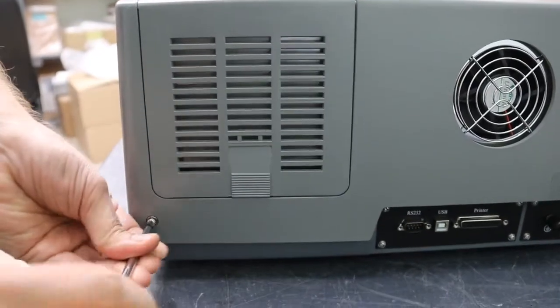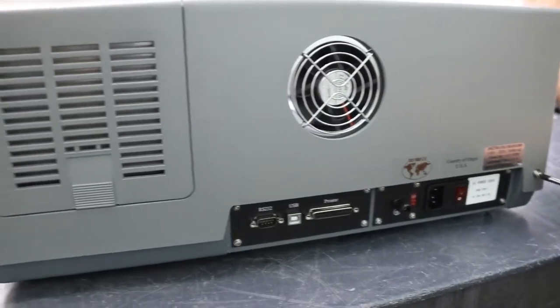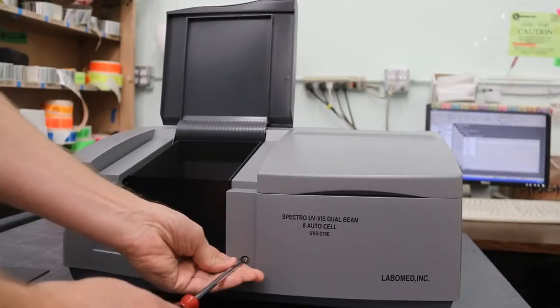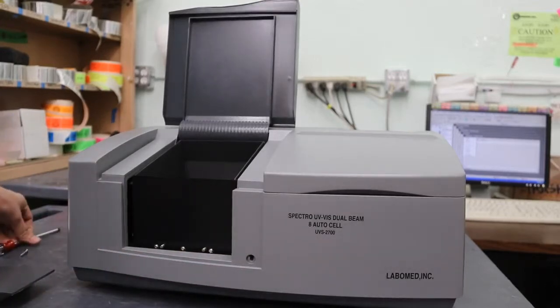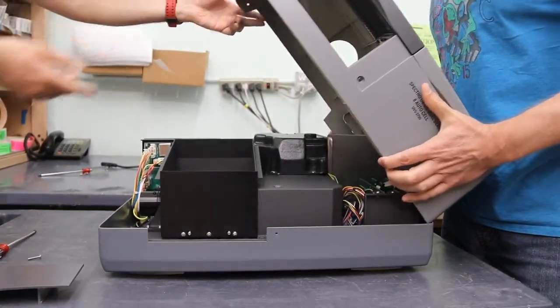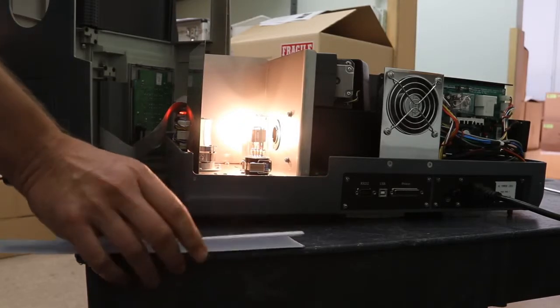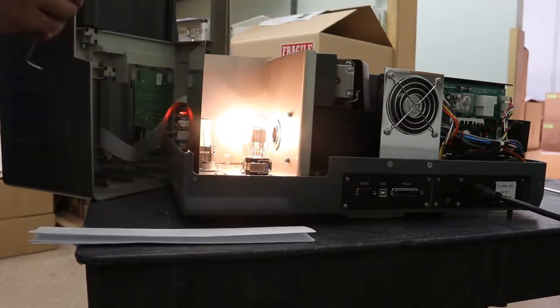Remove the screws that are holding the cover on. There are 2 in the rear. And there's 1 screw in the front. With the machine open, again, set the wavelength to 546. Check to see that the light is on the slit. If it is not, you may need to adjust the mirror.